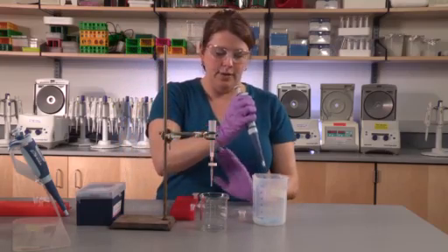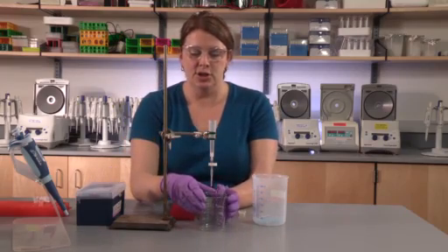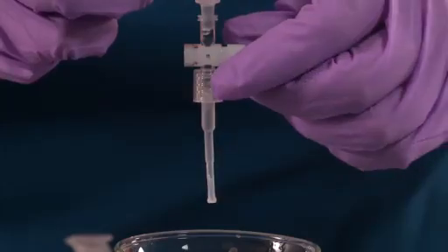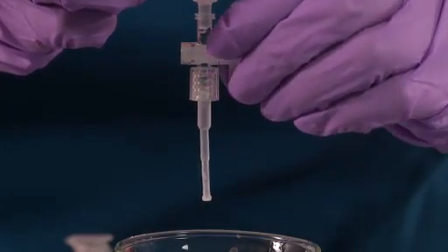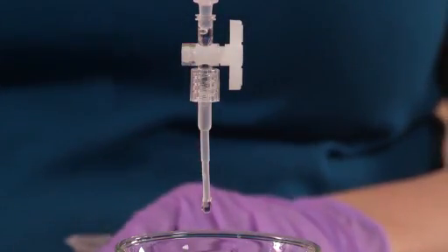Eject the tip, and at this point, using the beaker to catch the solution, gently open the stopcock and allow the elution buffer to drain.